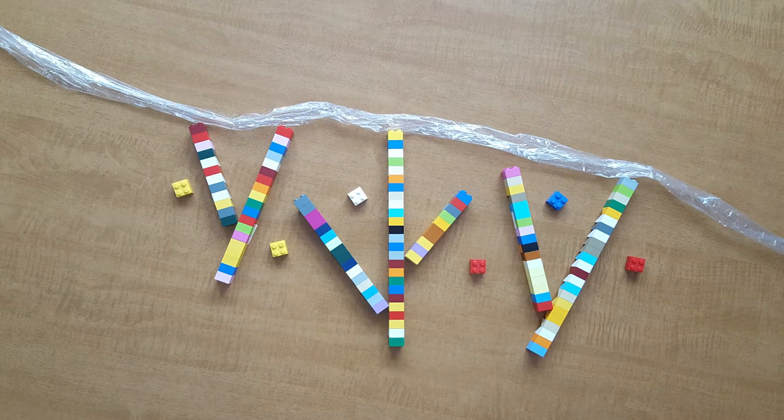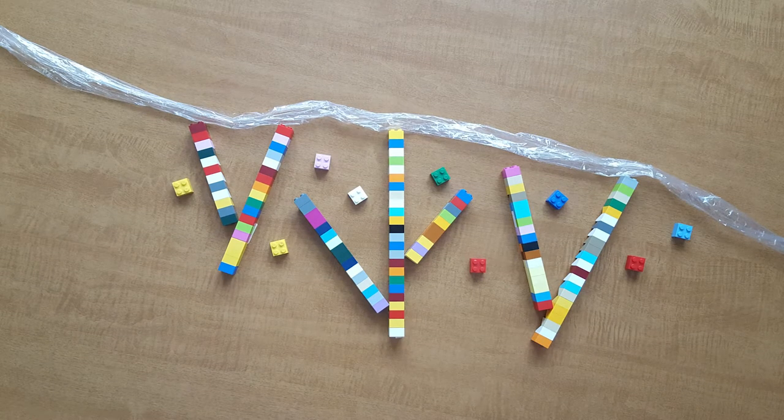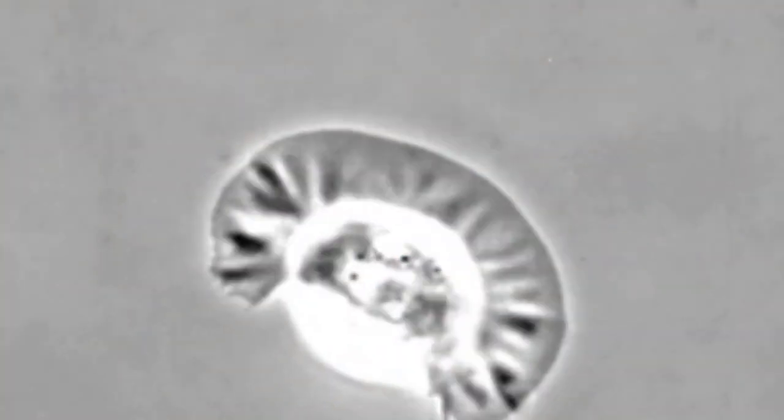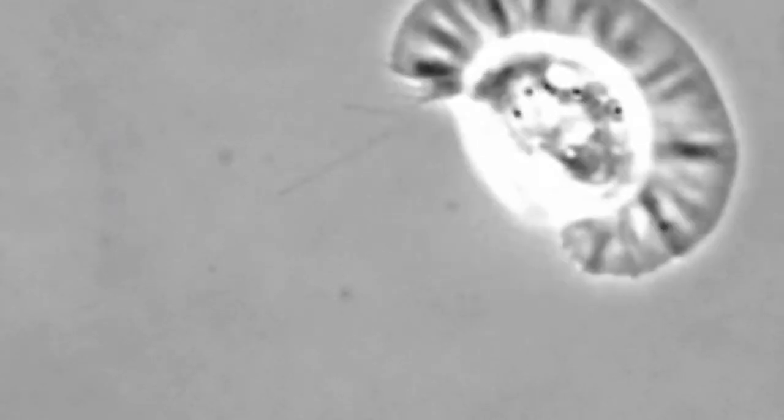Disassembling the actin filaments at the back helps the back of the cell move forward, and there you have it — a cell that crawls. The scientists wondered if the data they had collected from in vitro experiments matched with what was going on in real live cells. But it's hard to study the inside of a cell when it's crawling. That's where FRAP came in.